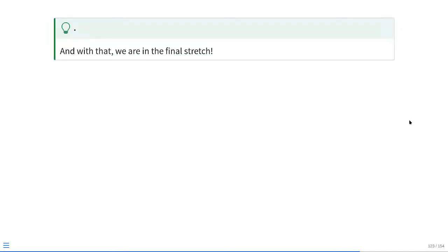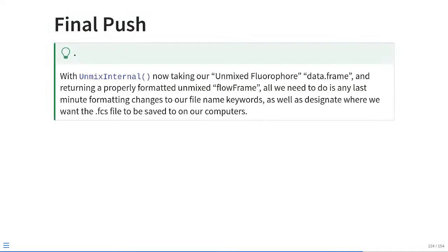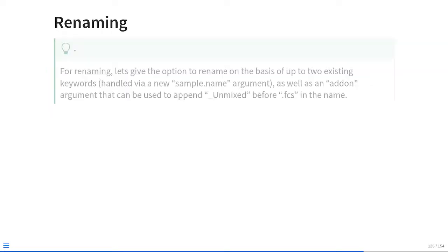And with that, we are in the final stretch. So, with UnmixInternal() now taking our unmixed fluorophore data.frame and returning to us a properly formatted unmixed flow frame, all we need to do is any of those last minute formatting steps in terms of file name keywords, as well as designating where we want the FCS file to be saved on our computers.